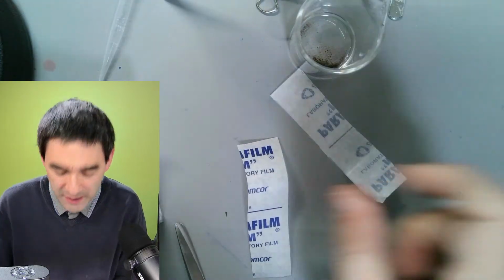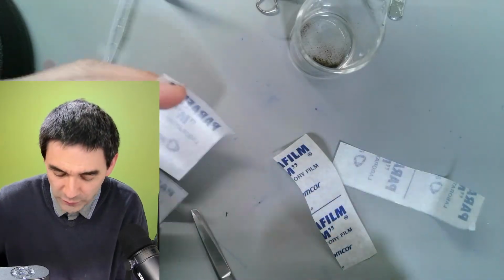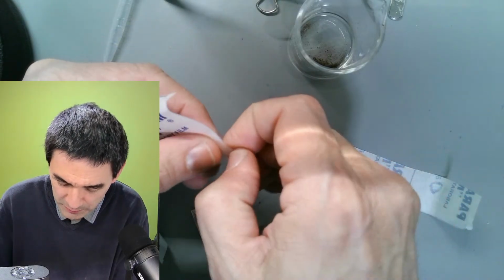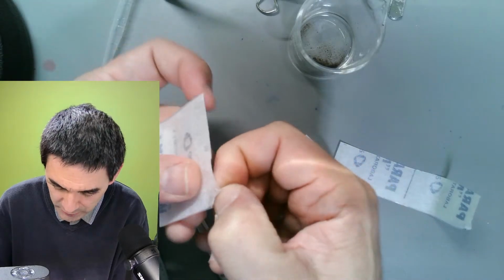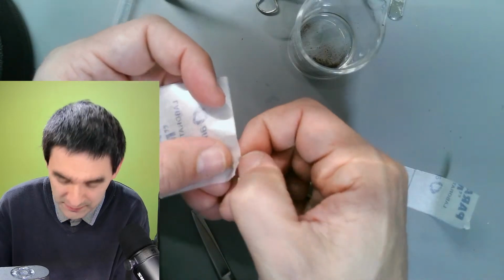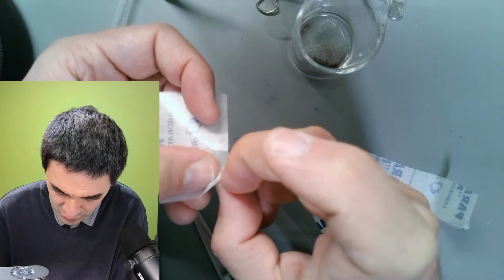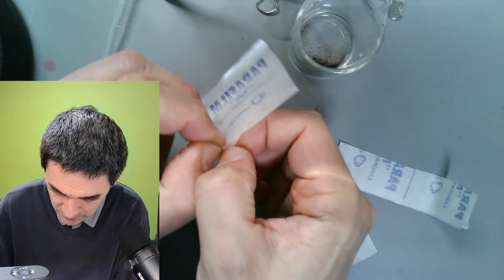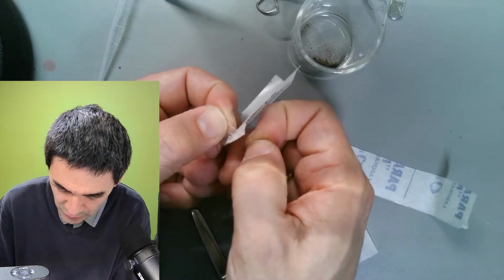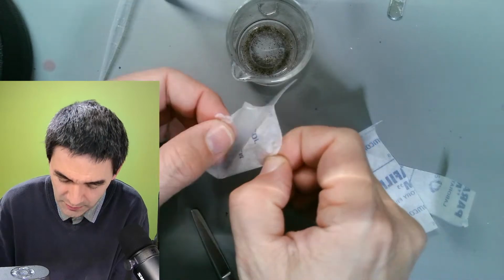No, I'm going to show you not. I cut it the wrong way. I'm going to show you something different. Look, a more useful way. You cut it square. Now you have to be a little bit patient. You have to let me stretch it maybe a little bit here. Yes, maybe that works better if you stretch it. You have to separate it from the paper. See, usually it goes very easily, but when you have a demonstration, you always have the so-called demonstration effect. Slowly, and especially when I'm stressed, things don't work quite the way that they should work. Yep, here we go. Okay, here we go.